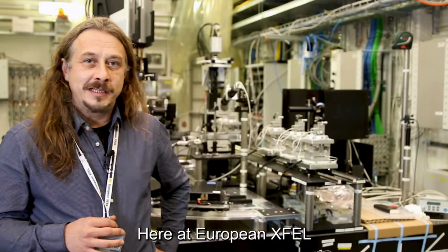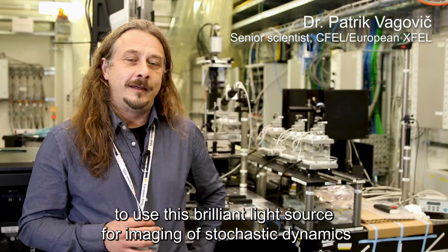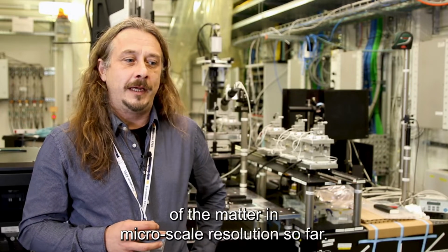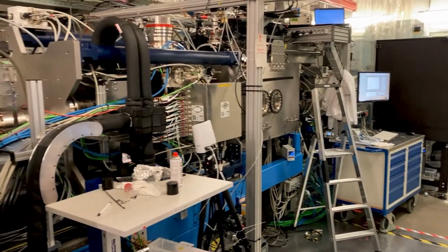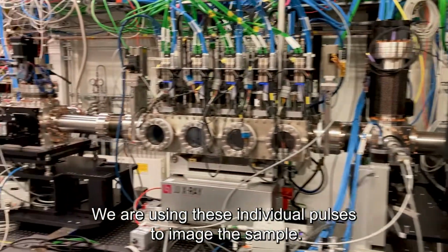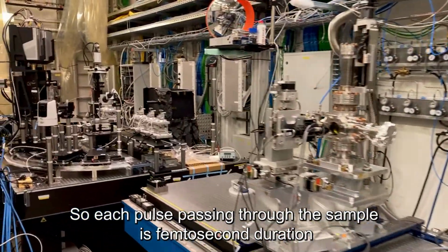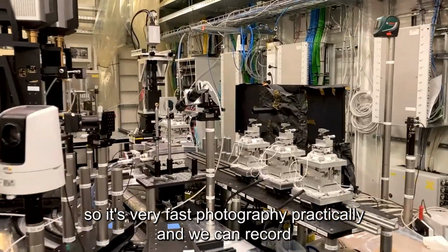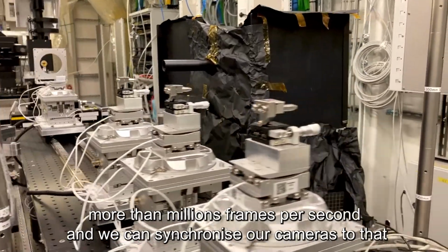So here in European XFEL, we are exploring the possibilities to use this brilliant light source for imaging of stochastic dynamics of the matter in the microscale resolution so far. So we are using these individual pulses to image the sample. Each pulse passing through the sample is a femtosecond duration, so it's a very fast photography practically. And we can record more than 1,000,000 frames per second, and we can synchronize our cameras to that.